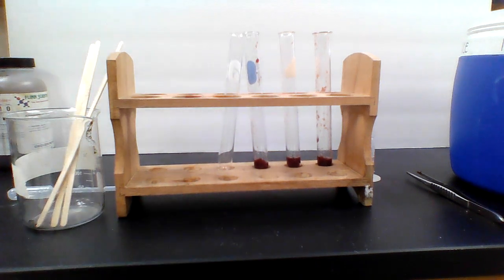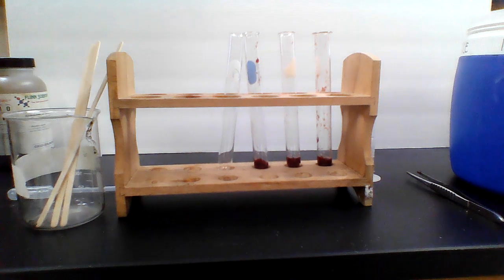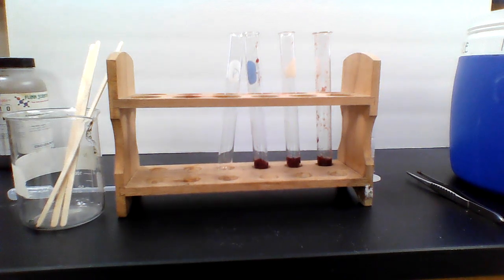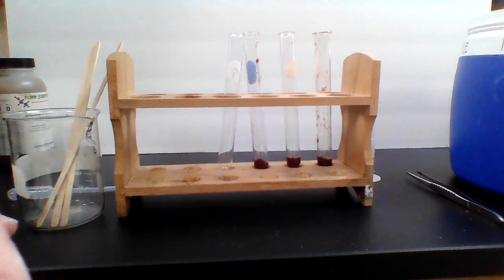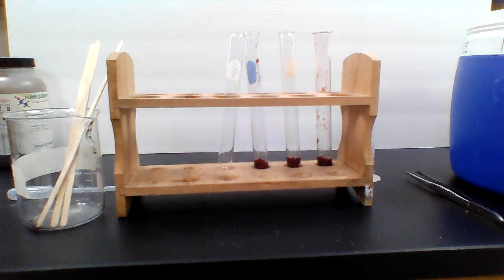Okay, the next one we're going to change. We're going to start messing with the pH of the liver. So remember, pH is whether something is an acid or a base. Your blood is supposed to be at a pH of 7, which is like water. And that's where your enzyme called catalase lives. You guys have the enzyme also. It's not just cows that have this enzyme. So it's supposed to work best at a pH of 7. So we'll see what impact adding acids and bases have.